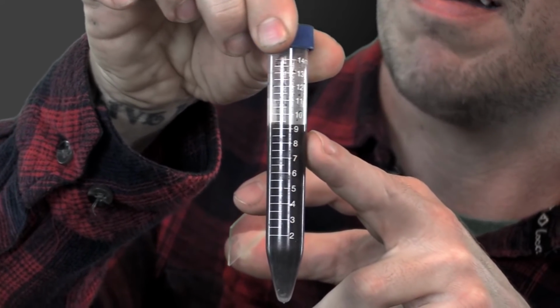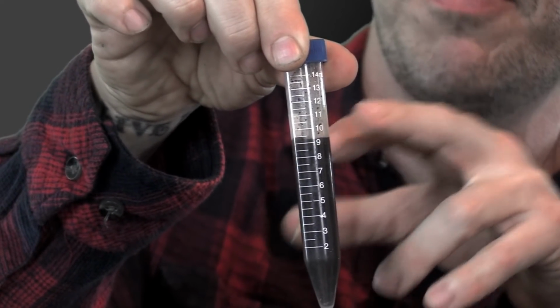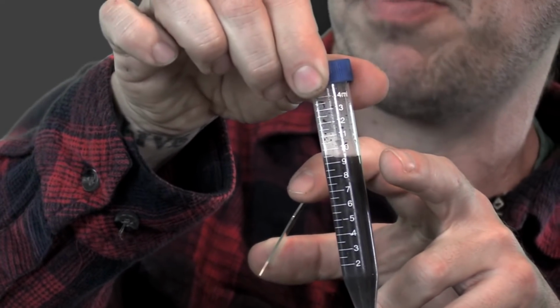Clean slide. Just to reiterate for this question, I filled this up to 9 milliliters of water. I've already taken some out of here now, that's why it's down. But it was filled up to 9 milliliters of water and then 1 milliliter of the solid, which was a worm or compost sample, added to the top of that. So we had an equal full 10 parts, but we've taken some drops out. And then we shake that up 30 times like this.